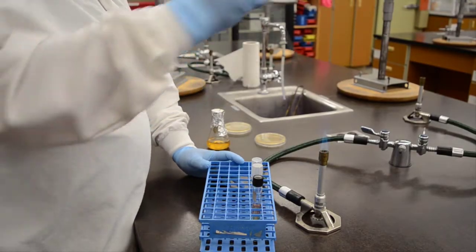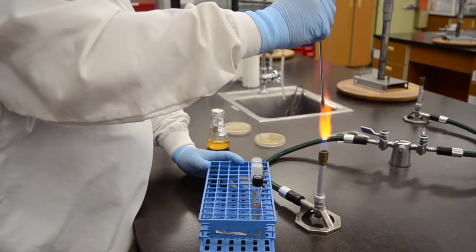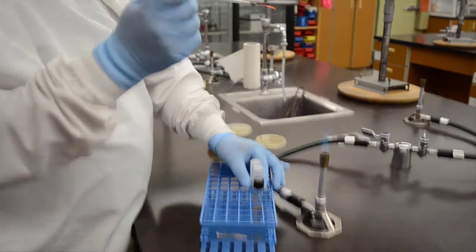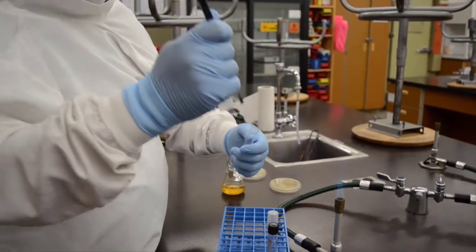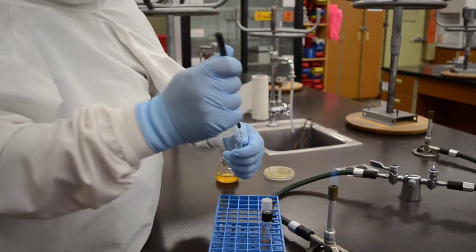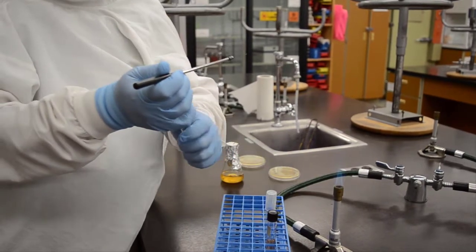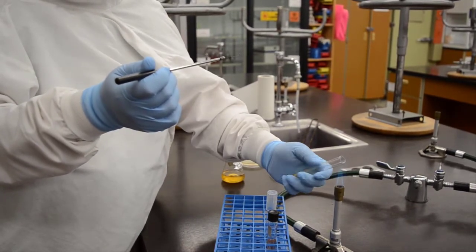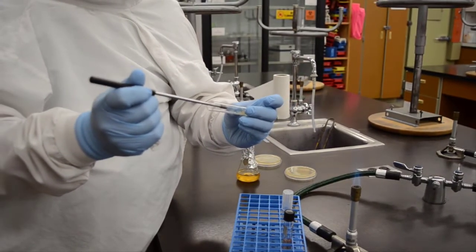Here we're going to transfer inoculum from a broth and then streak it onto the surface of a solid media called a slant. It's called a slant because the solid medium is set up inside the tube in a slanted orientation, which you'll see in just a moment. So you flame the loop, put the loop into the tube, get a bead of inoculum, and then get the recipient tube. Take the cap off, flame it, and then transfer the inoculum to the recipient tube.